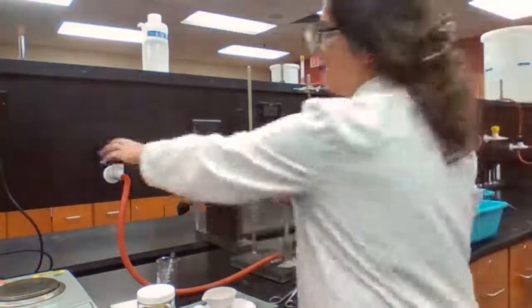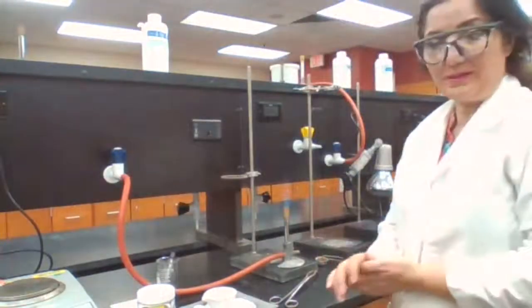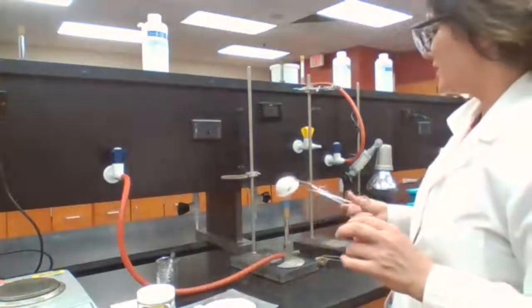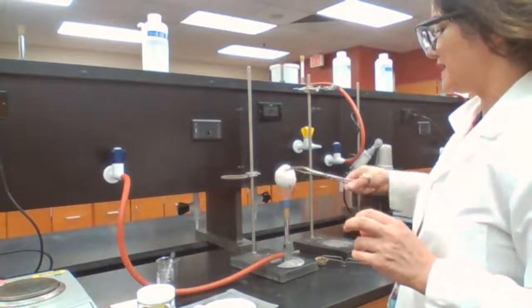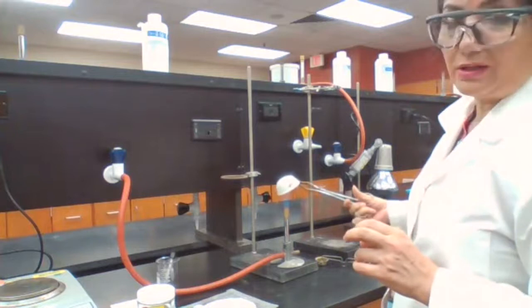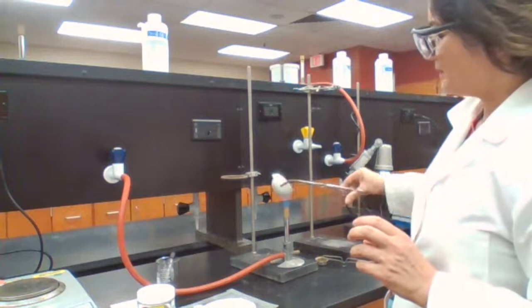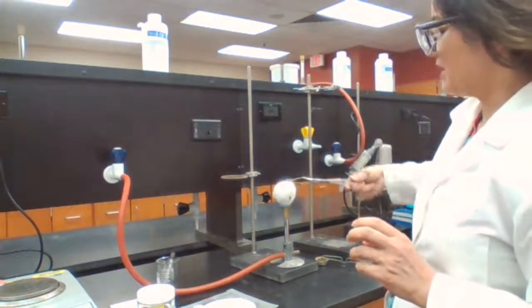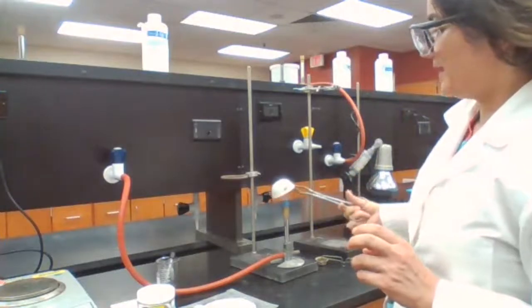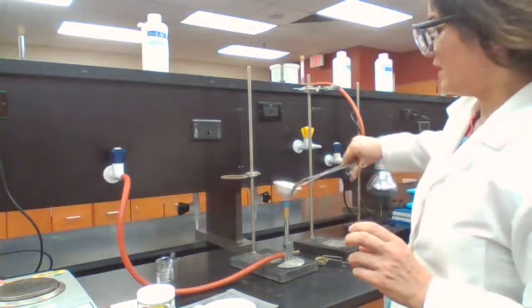But sometimes if we have enough supply and we read ahead and are prepared to do the experiment, then we can combine 2 steps. We can actually be more efficient. So I'm going to fire the second evaporating dish while we are waiting for the yellow color to disappear, for the iodine to react with the zinc completely. So I can actually use the time to prepare equipment and chemicals for part 2 of the experiment.